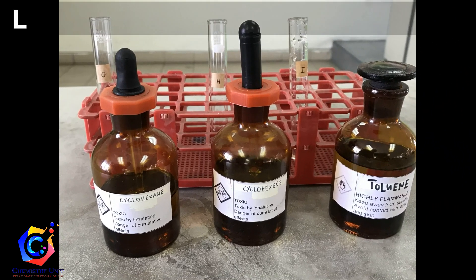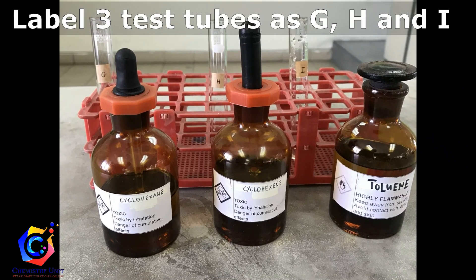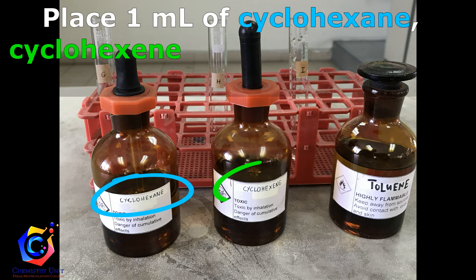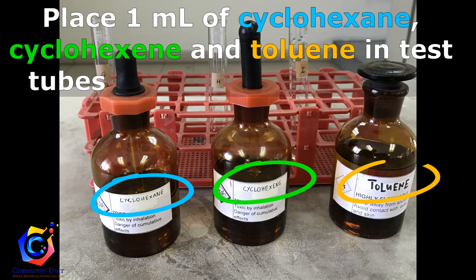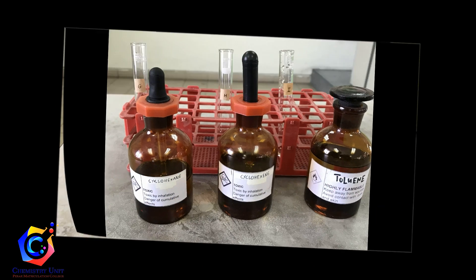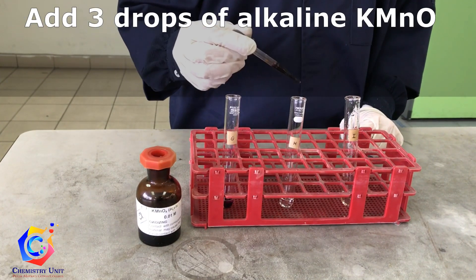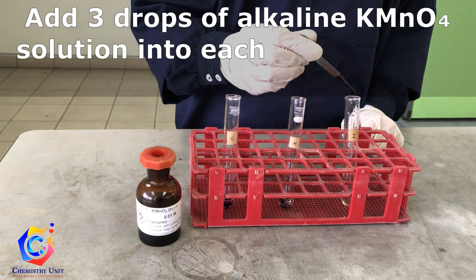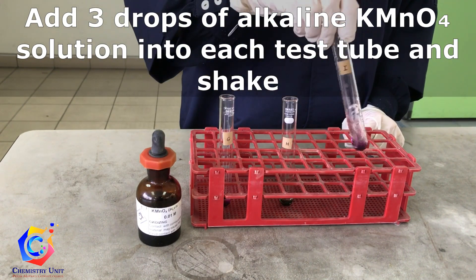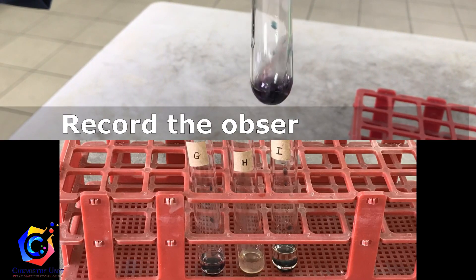Label 3 test tubes as G, H and I. Place 1 ml of cyclohexane, cyclohexene and toluene in test tubes G, H and I respectively. Add 3 drops of alkaline potassium permanganate solution into each test tube, shake, and record the observations.